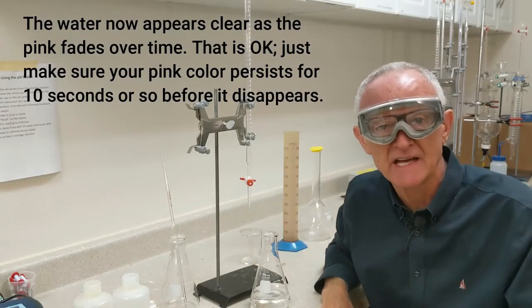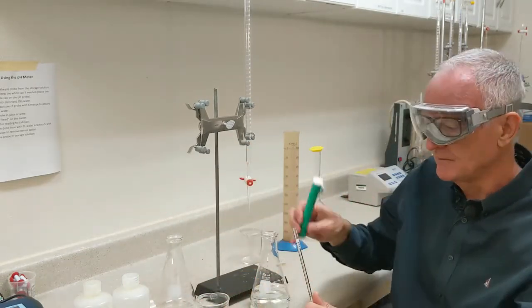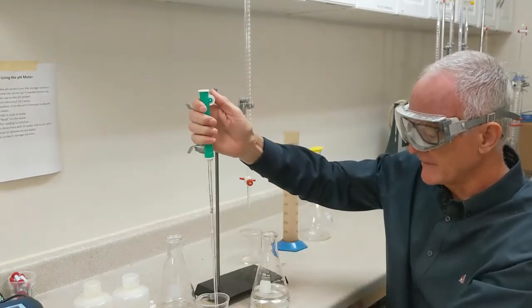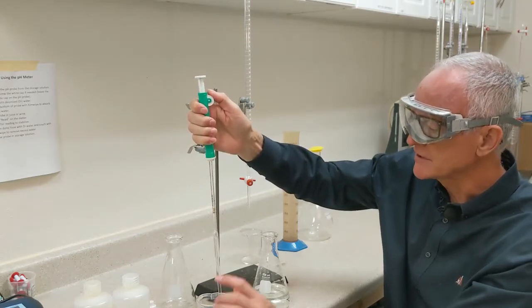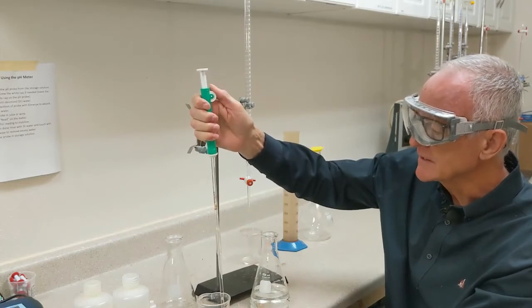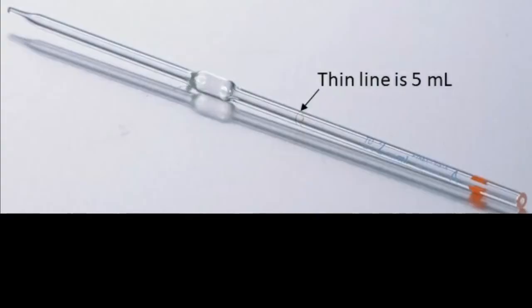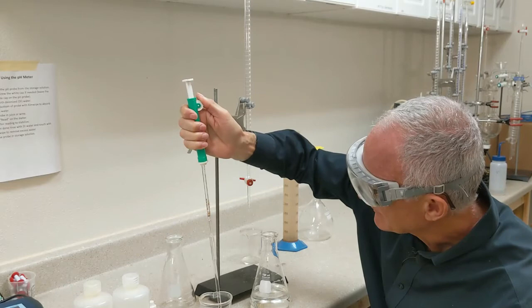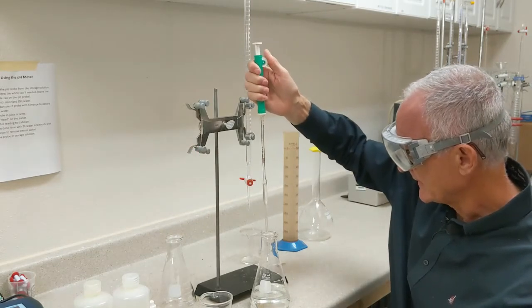The next thing I'm going to do is add my wine to my water. So I want to add five mils of wine, according to our protocol. Sometimes you could use more. Five's pretty traditional. And I have a volumetric pipette here that when I draw wine up to this little thin line there, that's going to be exactly five mils. I want to read the bottom of the meniscus, just like you do when you read a hydrometer. And make sure that bottom of the meniscus is right on that line.